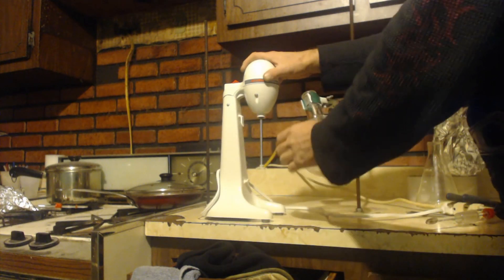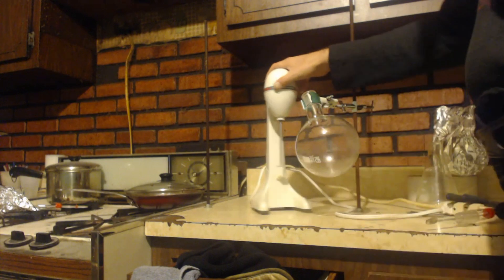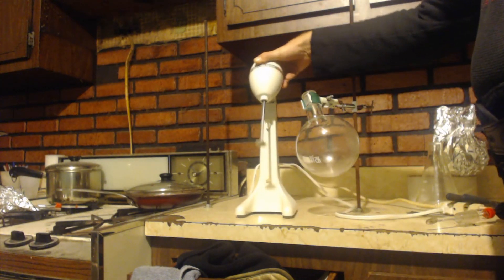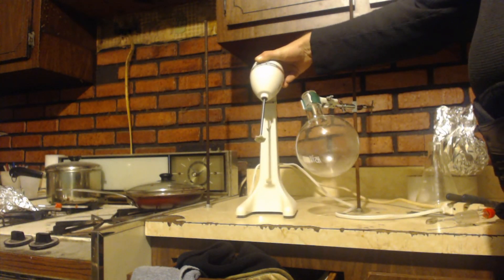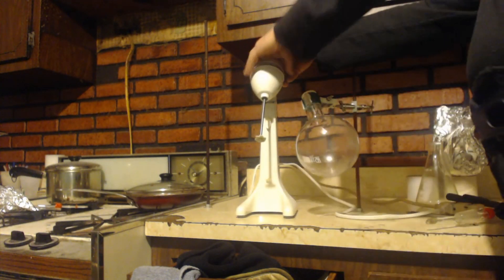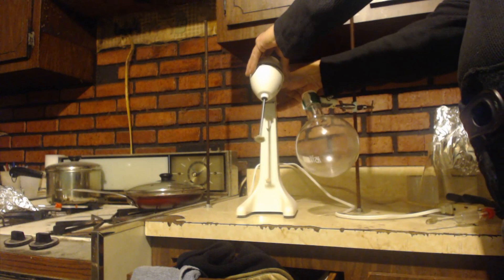But what you can do is this pivots back and forth. Even when it's pivoted you can still turn it on.